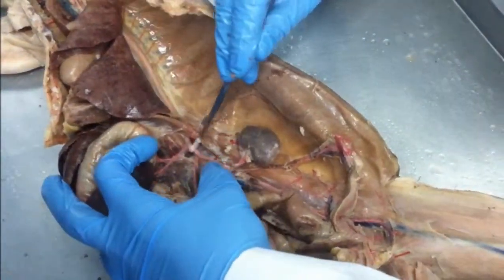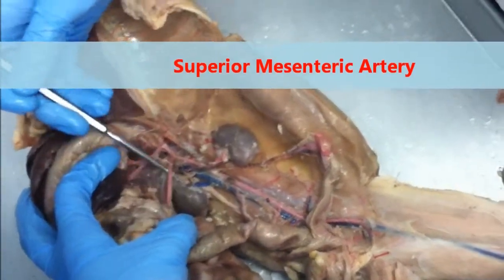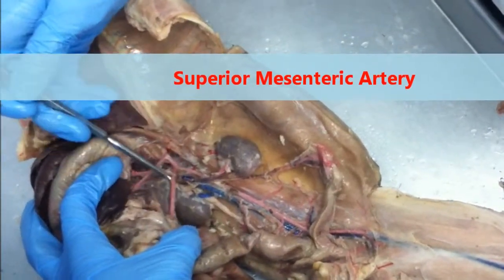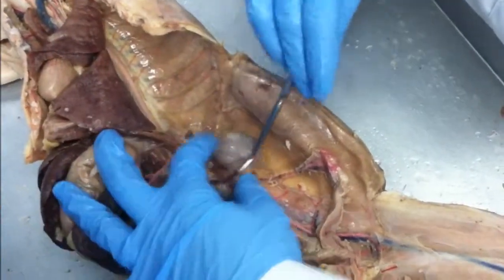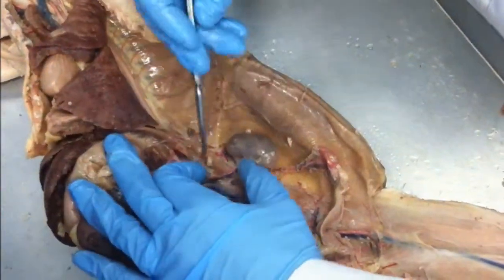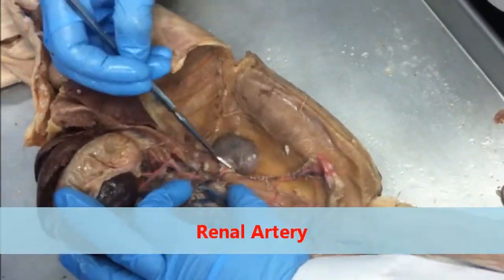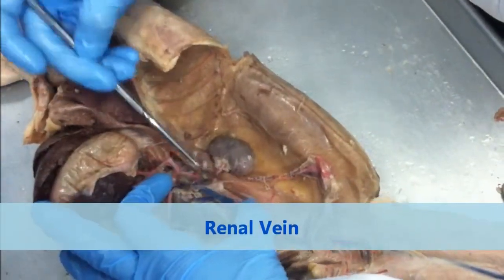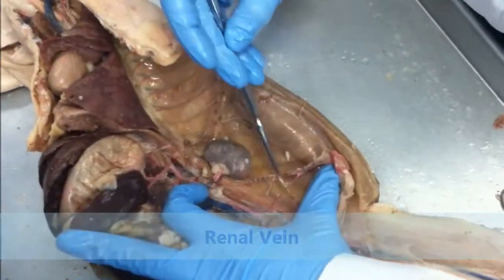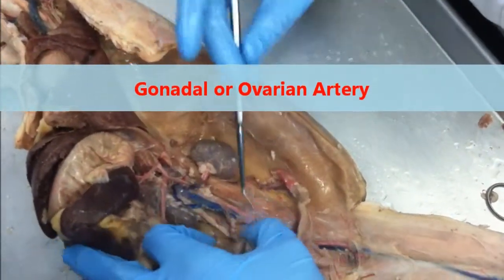The next split down on my abdominal aorta is my superior mesenteric artery. Okay? Goes right down in this diagonal fashion. Below that, the next split down on my abdominal aorta is my renal artery, since we're talking about arteries. I can also see clearly my renal vein. Okay? Down from that, the next split would be my gonadal, or in this case, ovarian artery.